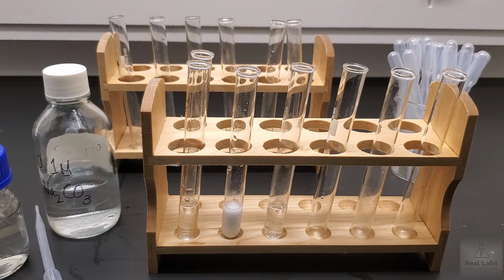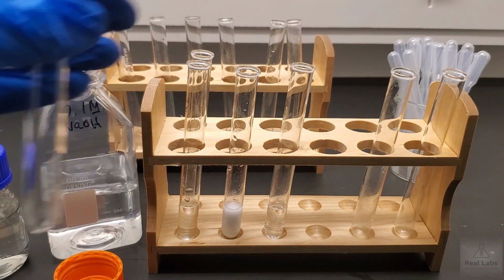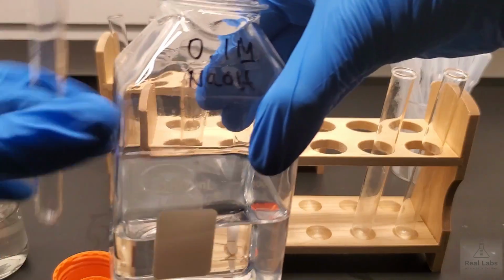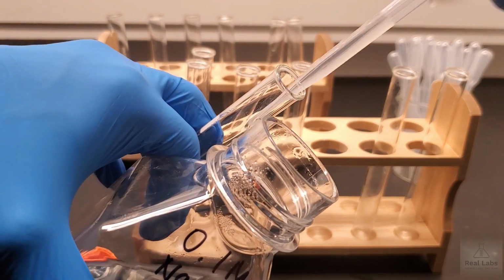Our fourth pair that we're going to work with is sodium hydroxide. We're going to use like a 10% or actually a 0.1M sodium hydroxide system and a 6M HCl. So I'm just going to switch out the sodium carbonate. I'm going to use a 0.1M sodium hydroxide reaction. So the first thing we're going to do, we're going to get ourselves a clean test tube, and we're going to transfer in the sodium hydroxide. Same way we did before, keep the mouths close to each other so that's a short transition period.